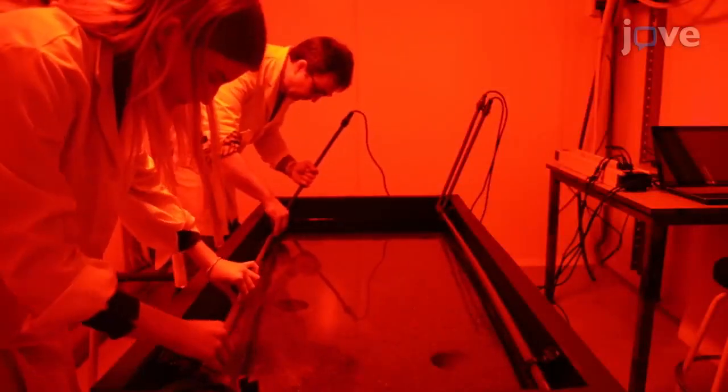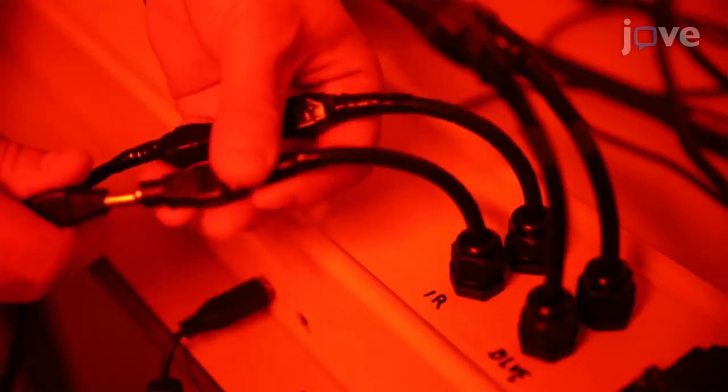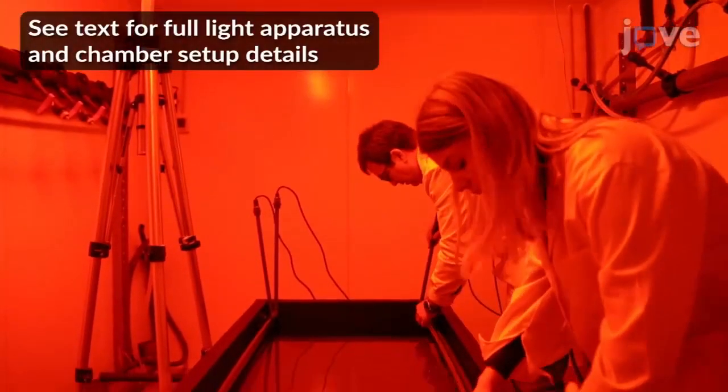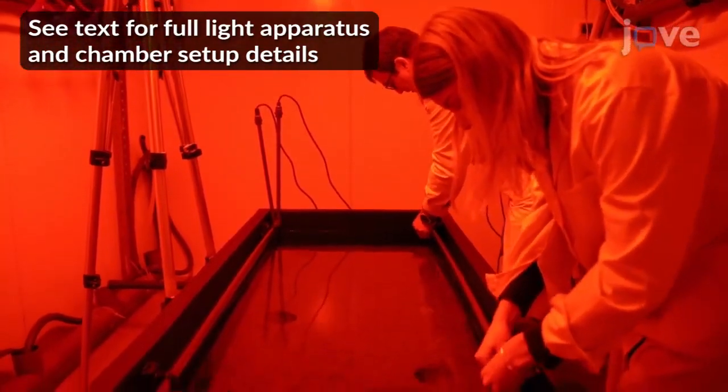To set up the experimental area, place infrared dark time LEDs into the tank. Keep the infrared lights on at all times. Next, place blue light time LED lights into a modified fiberglass tank containing sand and 4 flexible PVC pipe burrows and connect the lights to an apparatus for managing the photoperiod. When all of the lights have been placed, position a chilled seawater inlet at one corner of the tank with a corresponding outlet at the opposite corner.